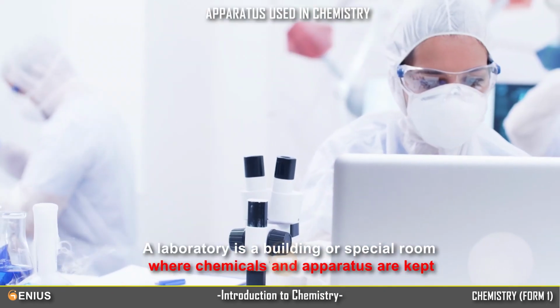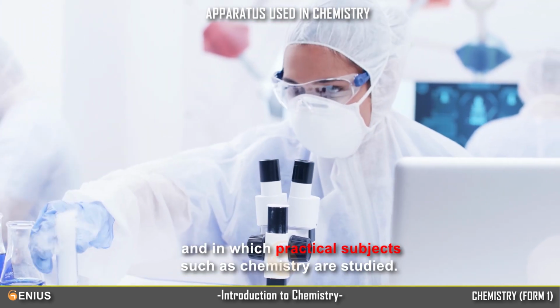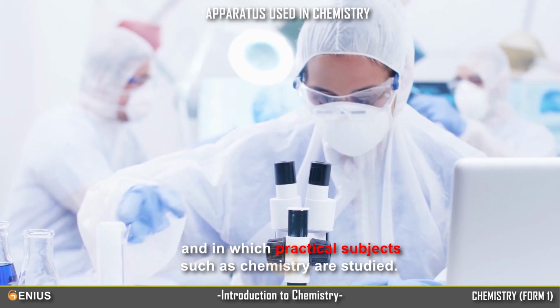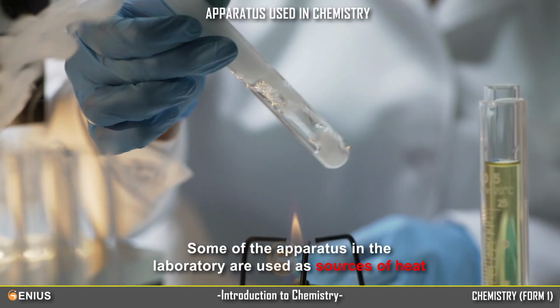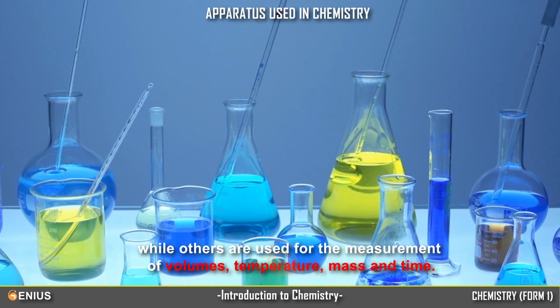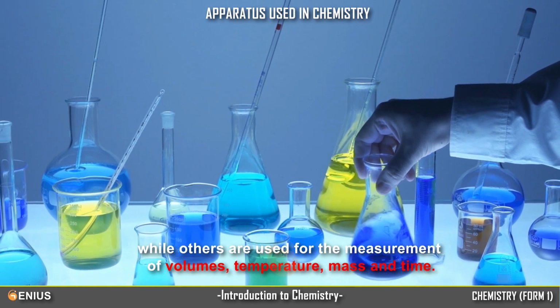A laboratory is a building or special room where chemicals and apparatus are kept and in which practical subjects, such as chemistry, are studied. Some of the apparatus in the laboratory are used as sources of heat, while others are used for the measurement of volumes, temperature, mass, and time.